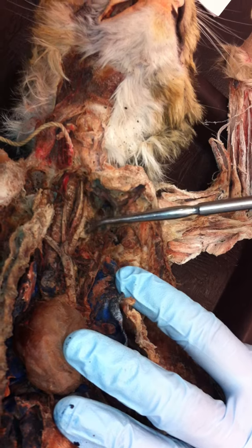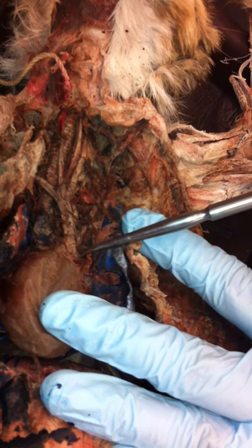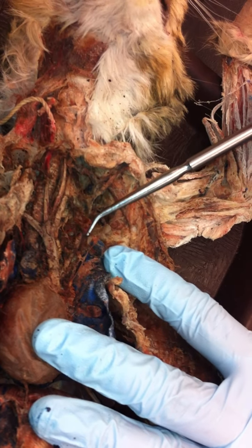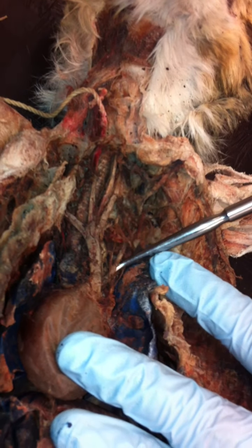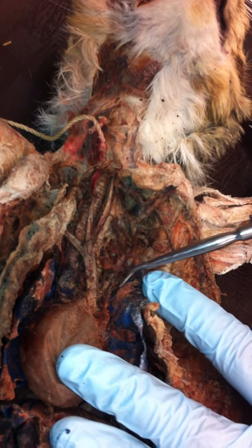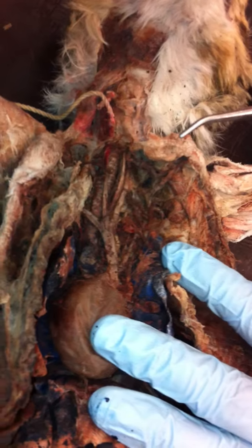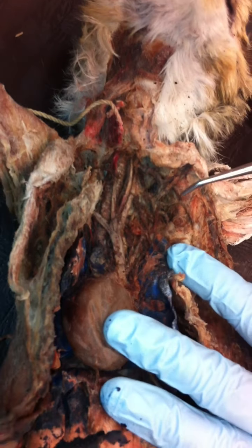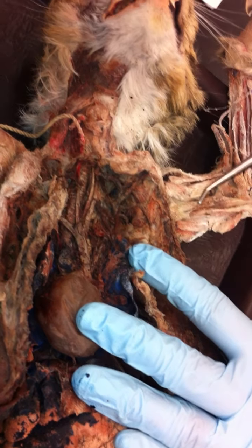Here, left common carotid. Okay, and then way back down here, because it branches off the aorta, is the left subclavian artery. Okay, that's this one right here. So you can count 1, 2, 3, 4. Is that last one hidden? It will go right there, yeah. Okay? You're going to have to kind of just find that one. It's going to be right beside the big brachiocephalic artery. Okay? In humans, this branches off down there. The left common carotid. Yeah, there's 3 branches off there. Okay? But you guys just need to know how to identify that on the cat. Okay?